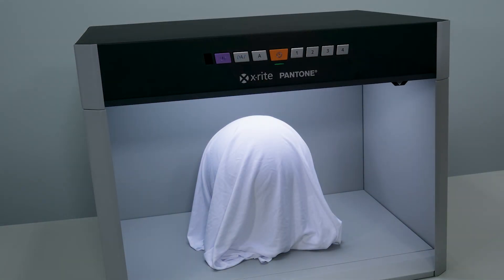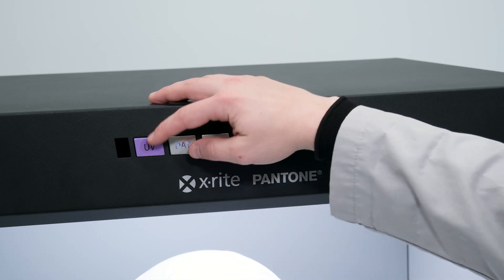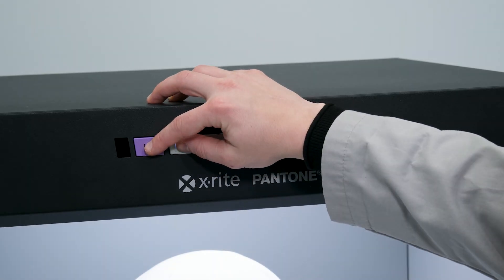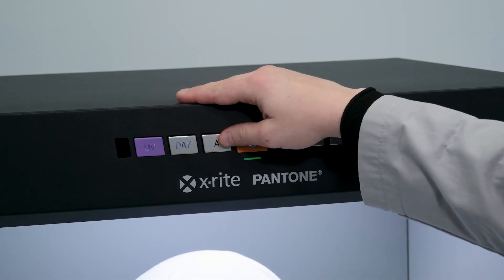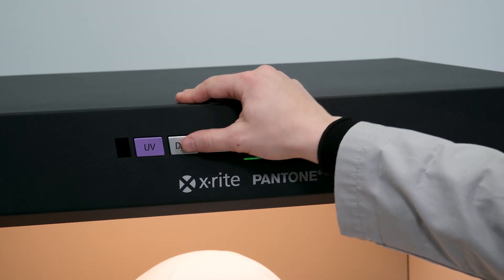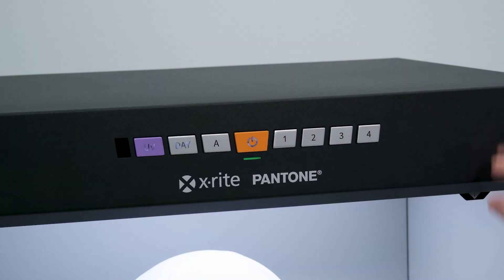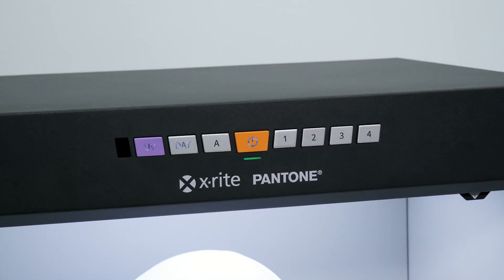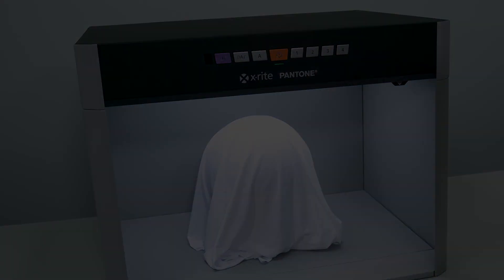Both D65 and D50 can sync with UV so that when you push the corresponding button, UV automatically turns on. To enable this, either long press the day and UV buttons or button 1 and UV for 3 seconds. In this case, pressing day will now automatically turn UV on. Hold both buttons for 3 seconds again to turn this feature off.